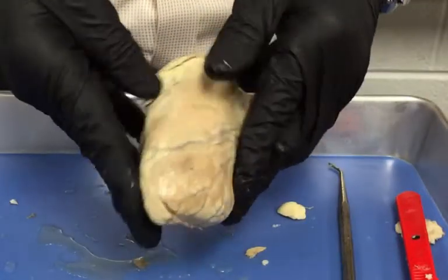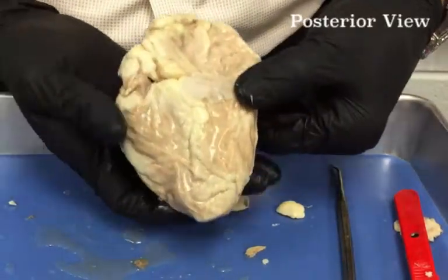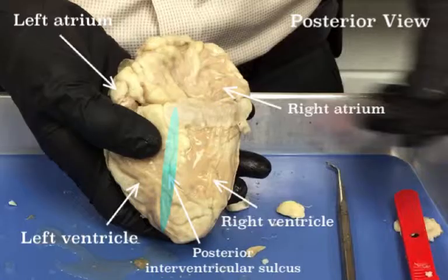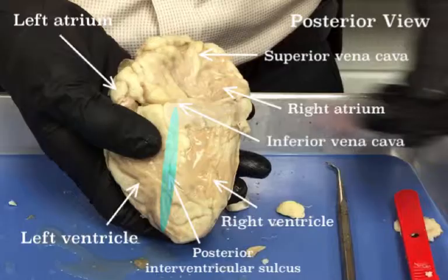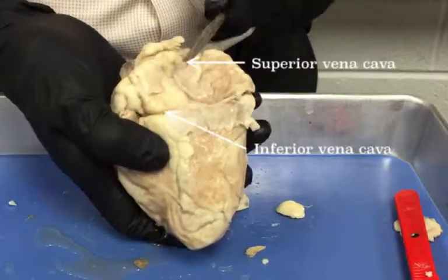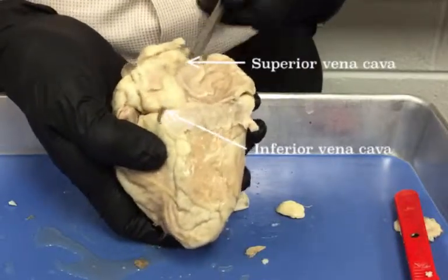Now turn your heart over in the tray so the posterior side is facing up. You can still see the ventricles and atria, but now the left is on your left and the right is on your right. You can also see the posterior interventricular sulcus and the superior and inferior vena cava. Since these vessels both lead to the right atrium, you can put a probe in one and have it come out the other.